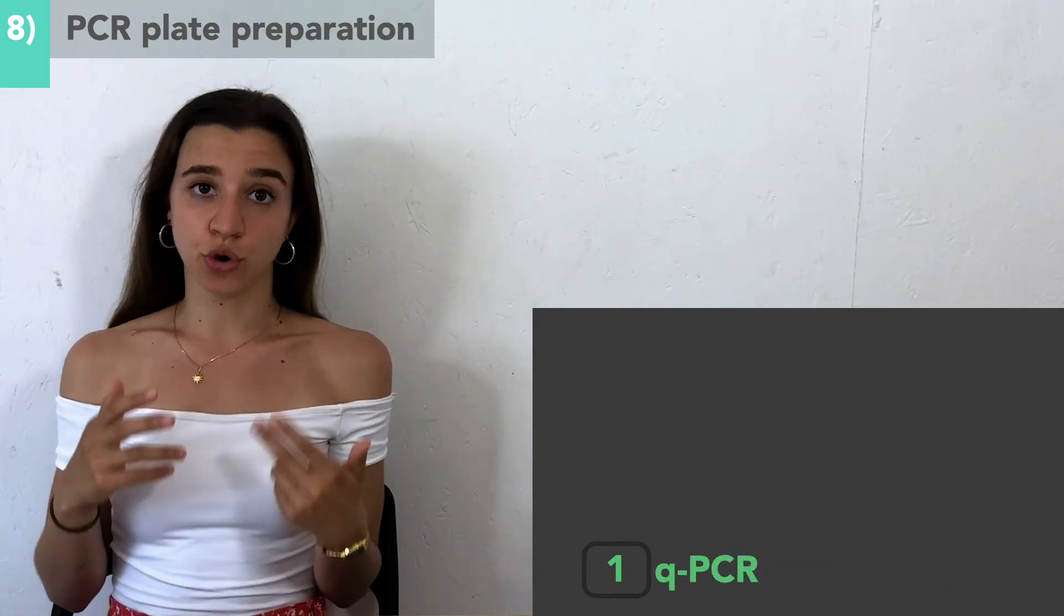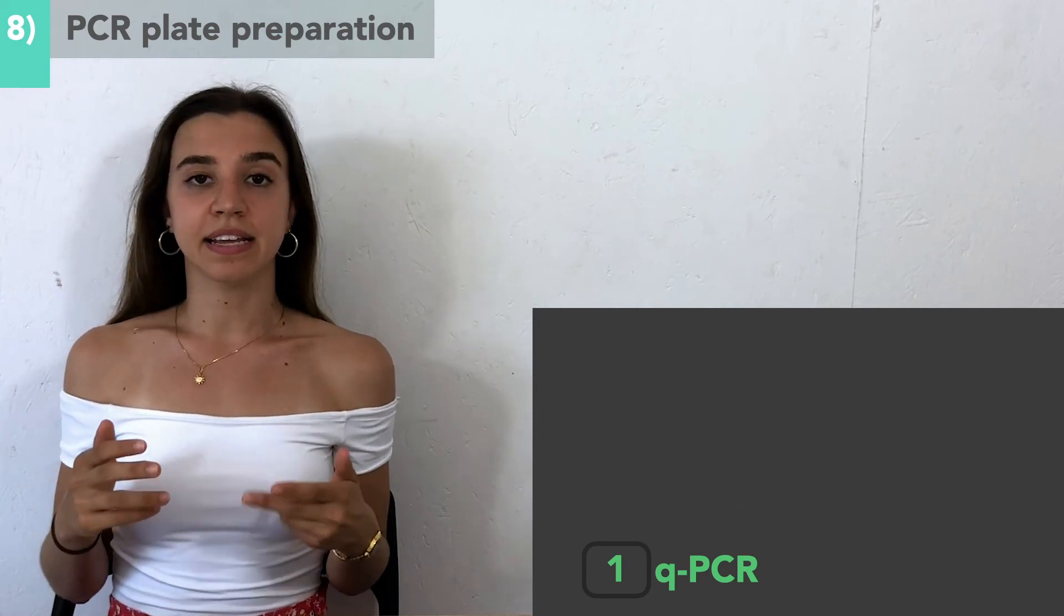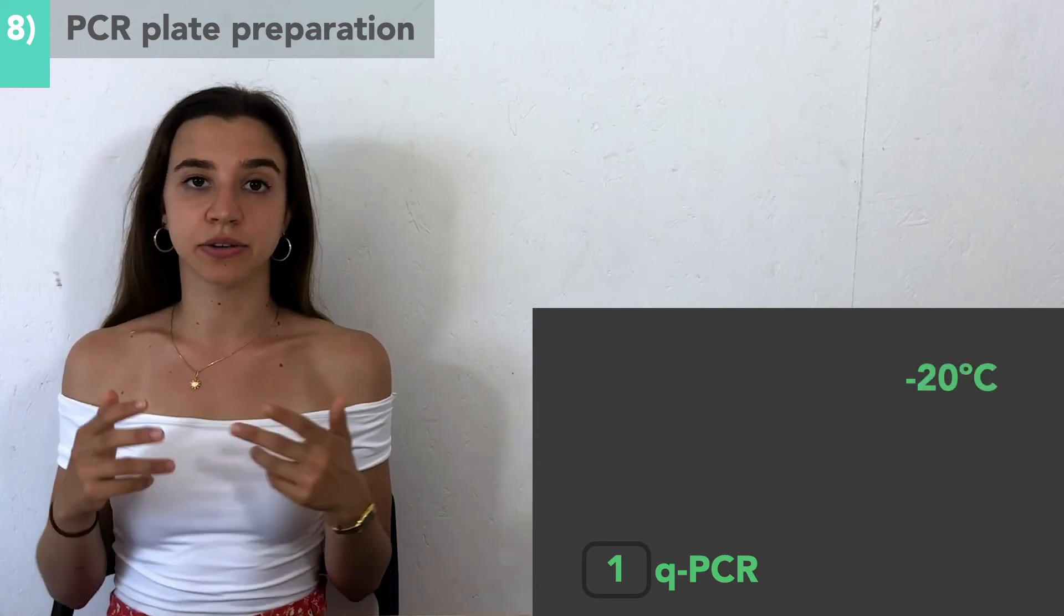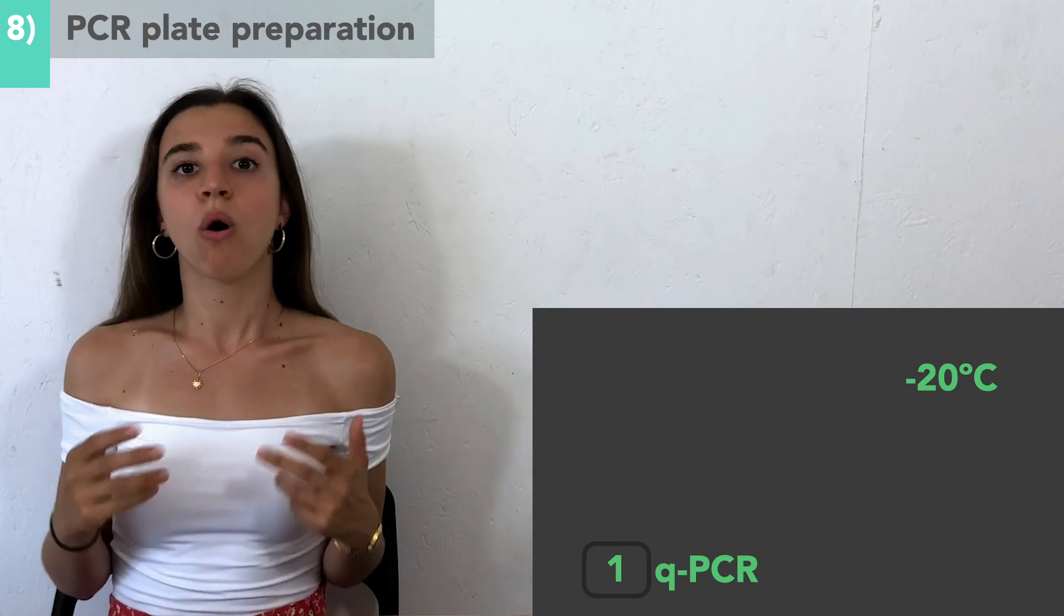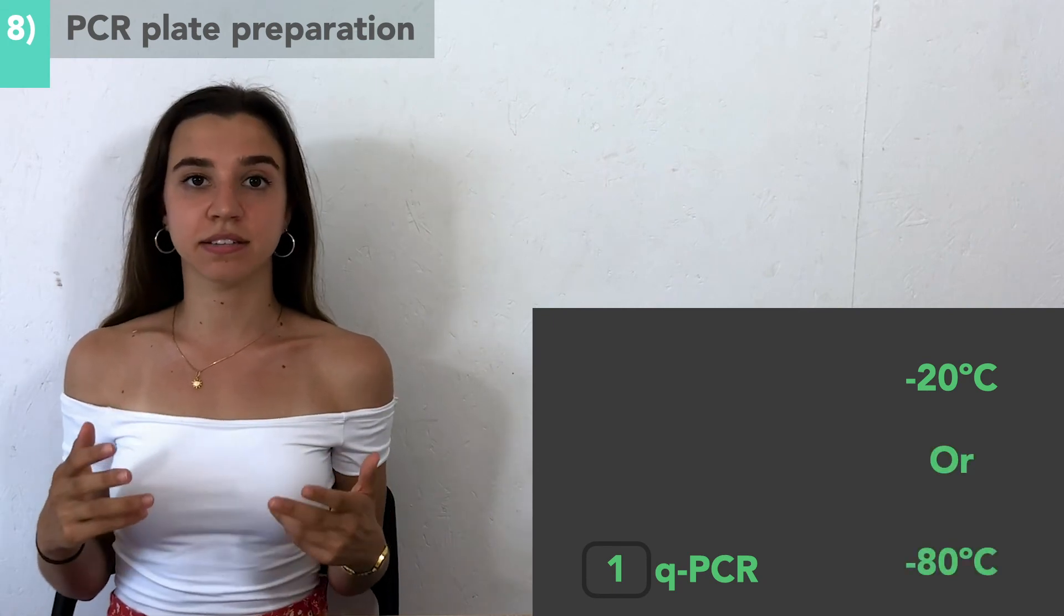If the samples are not immediately used in Station C, they can either be stored at -20°C or -80°C long-term.